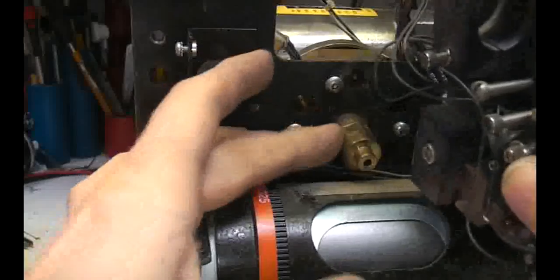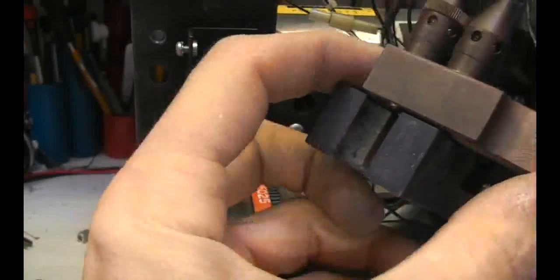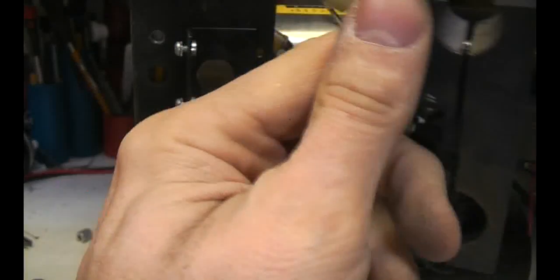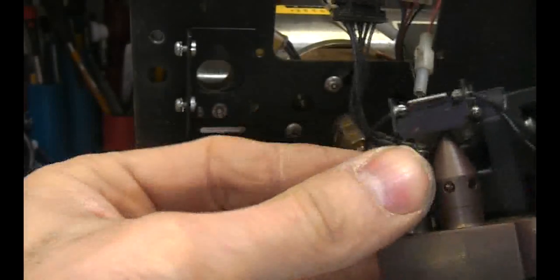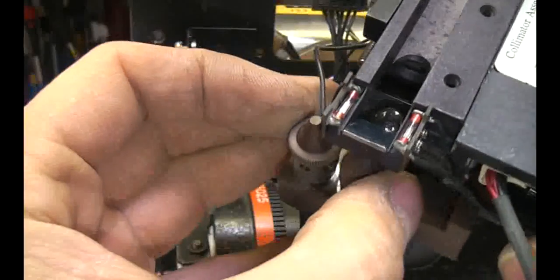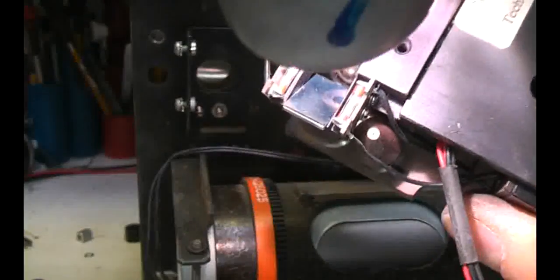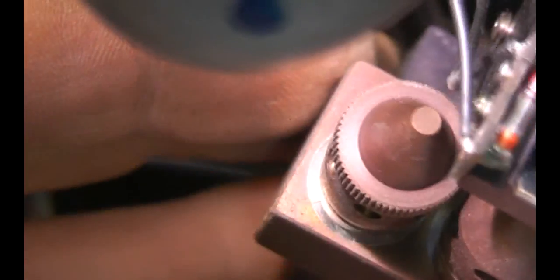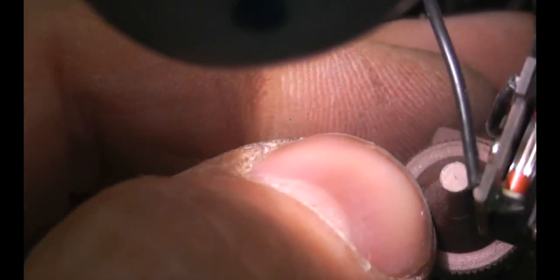This whole optical block just seems to be attached to the output of the x-ray tube, which is the mechanical reference. We've got two different collimators that can be switched - this looks like a block of brass. They appear to screw on, so there are probably different versions depending on the application. One has a tiny little hole I can barely see - maybe 0.2 mm. The other one: I'm not sure if there's actually a hole in there at all; if it is, it's very very tiny - probably under 0.1 mm.